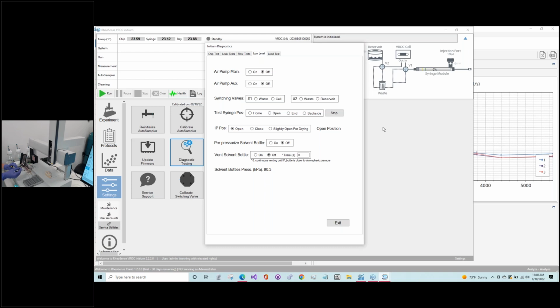So it's just a matter of loosening this connector and then removing the screw from the block in the back here. And if you're just changing out the piston, then you can just pull it out, remove it, and put the new one in. And you want to be careful when you're putting in the brand new ones, because they are very, very tight. So you want to gently push it in so that you don't bend that rod on the piston. And then you put it back in place, just the reverse.